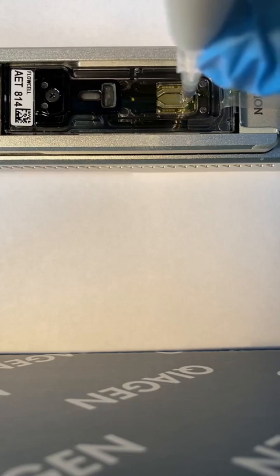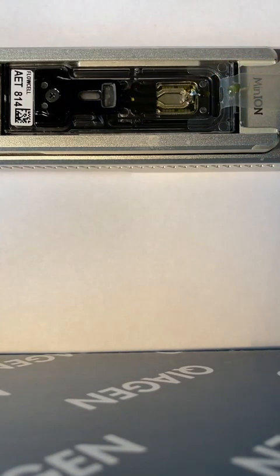The other two that I was running, the day before I ran this one, it took me about 5 minutes to actually get those in. And I actually lost a lot of pores. I destroyed them because some bubble went in there. And I pipetted back and forth a few times, which you don't want to do. The goal is to put that into there and dispense it or pipette it all in one shot smoothly like you just saw.